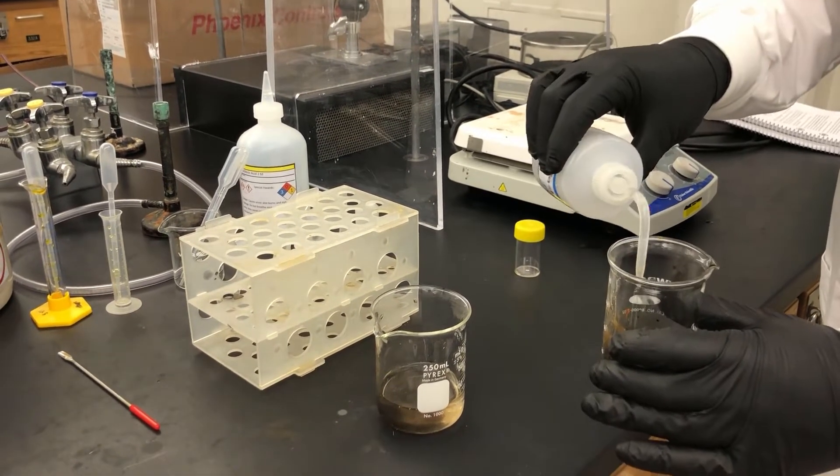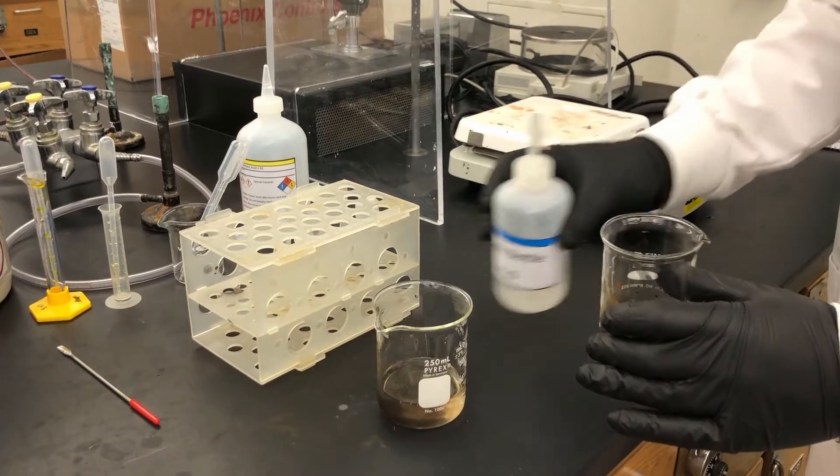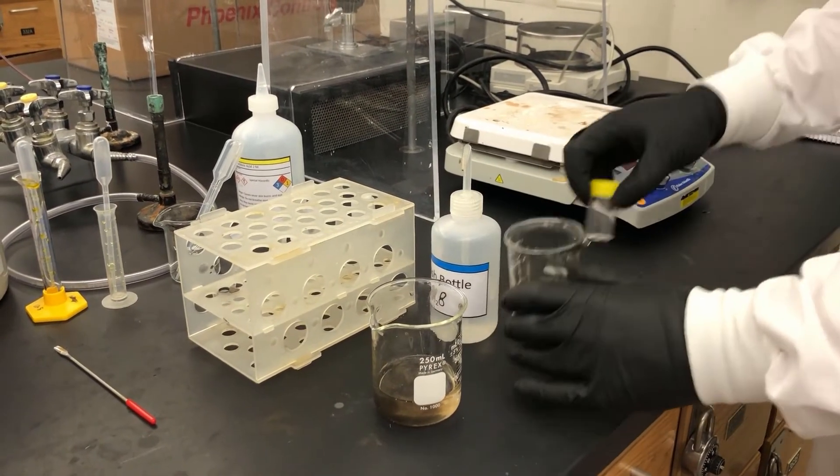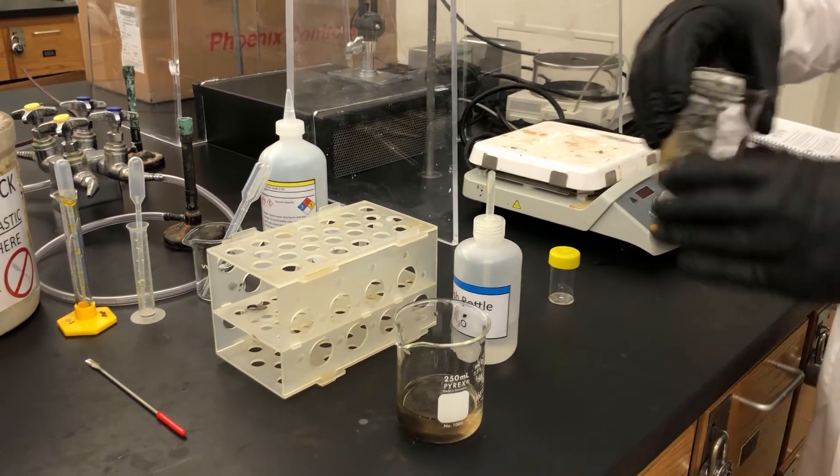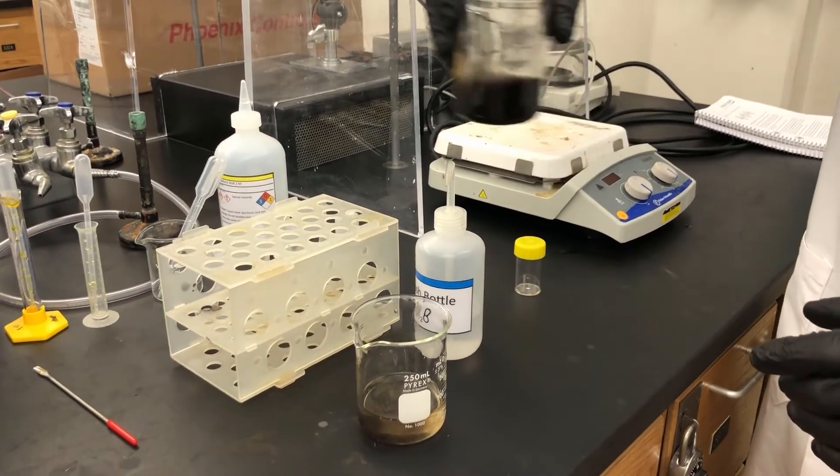So I'm going to go ahead and add some water so we can start transferring that. And what I'm going to do is I'm going to start swirling it. Oops. I'll take this magnet off so it's not still stuck to the bottom.